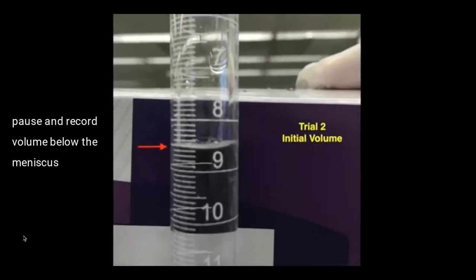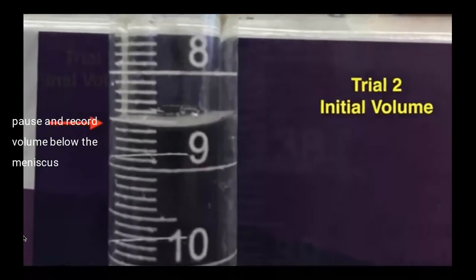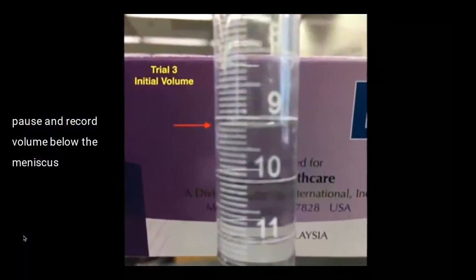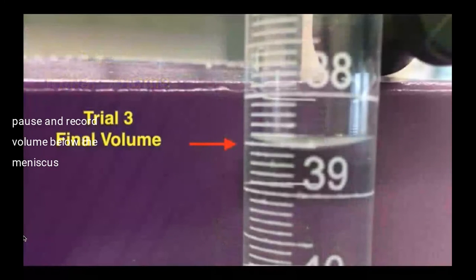For trial two, please record the initial volume of base and the final volume obtained. Do the same for trial three.